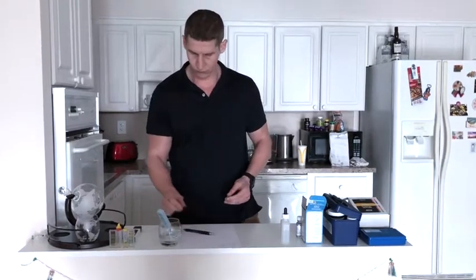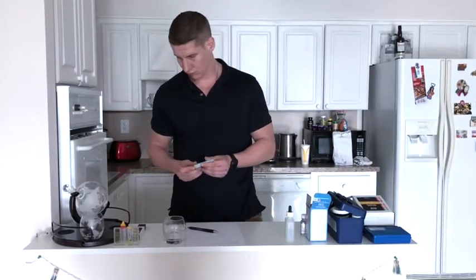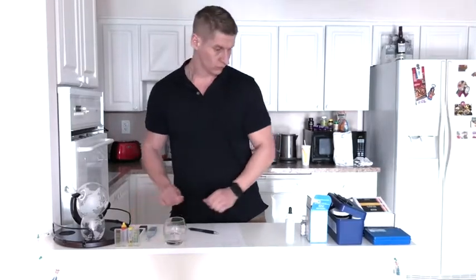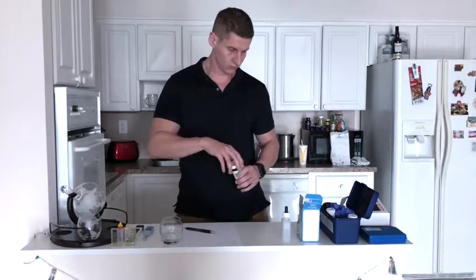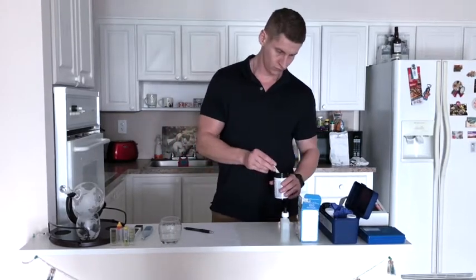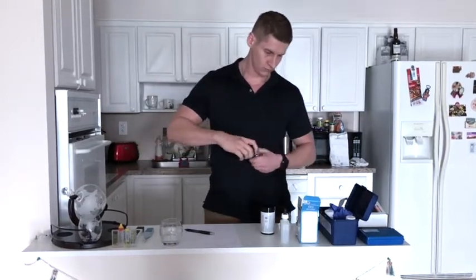Next, the specialist is testing the water for chlorine. Why is chlorine in drinking water dangerous? Because when chlorine mixes with even minute amounts of organic compounds that are very often found in water, harmful byproducts called trihalomethanes, or THMs, are produced. These byproducts produce free radicals in the body, which trigger cell damage and are highly carcinogenic, even in small amounts. The current number of chlorine is 0.5 parts per million.